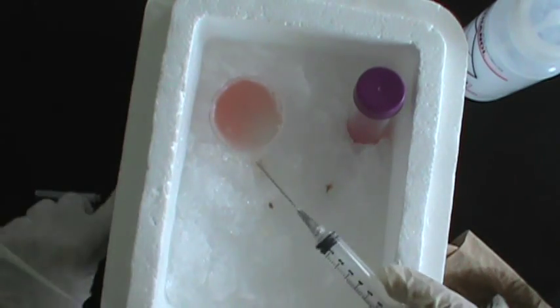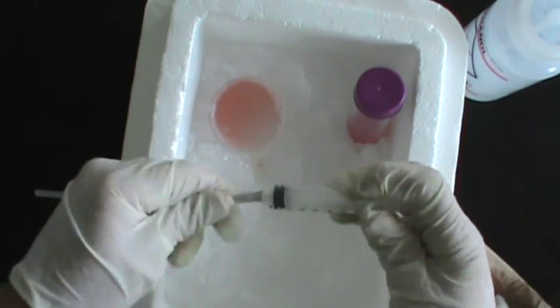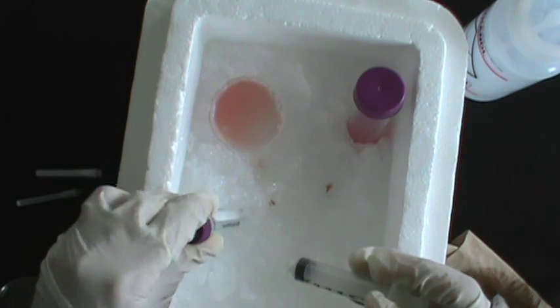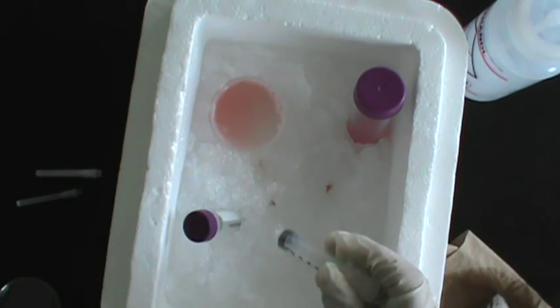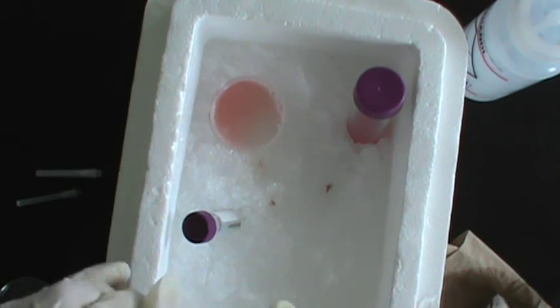Every time you put the needle back into change needles, please be careful putting the needle back in its sheath. We don't want anyone to stick themselves with a needle. At this point in the process, I'm going to stick a 15 milliliter sterile centrifuge tube on the ice so it can start to cool down.